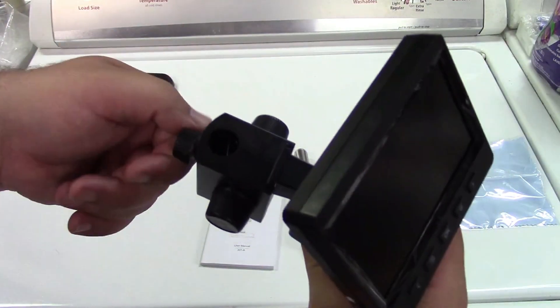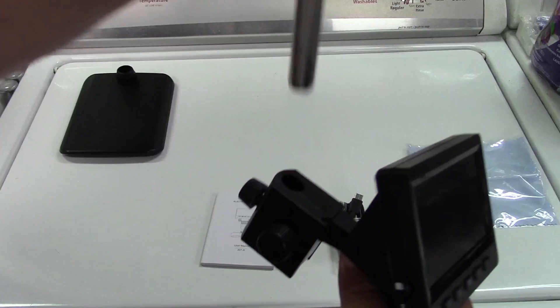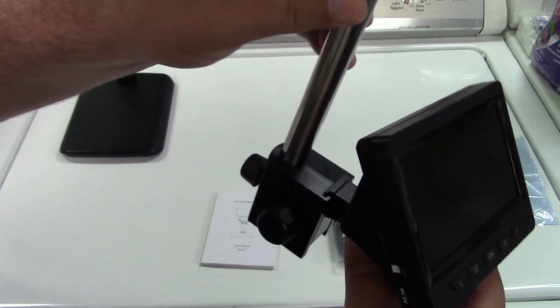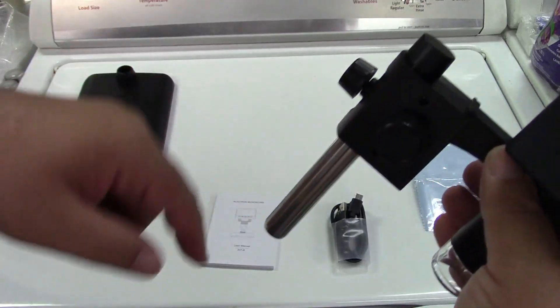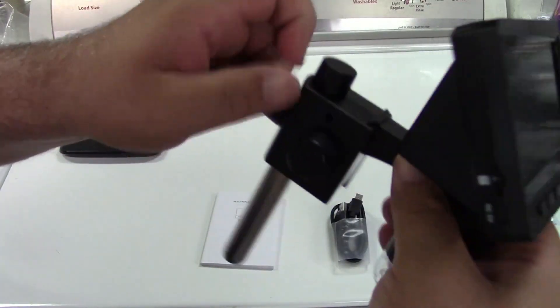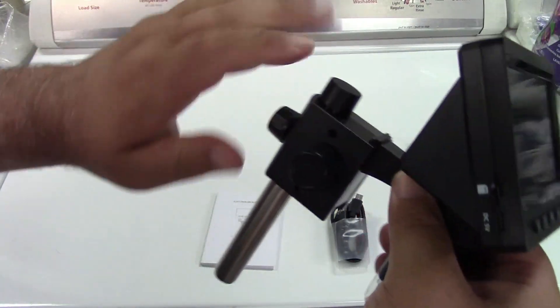For the back of it, undo that guy. Stick it down from the top. If you don't have that opened up enough, it's not going to go all the way.